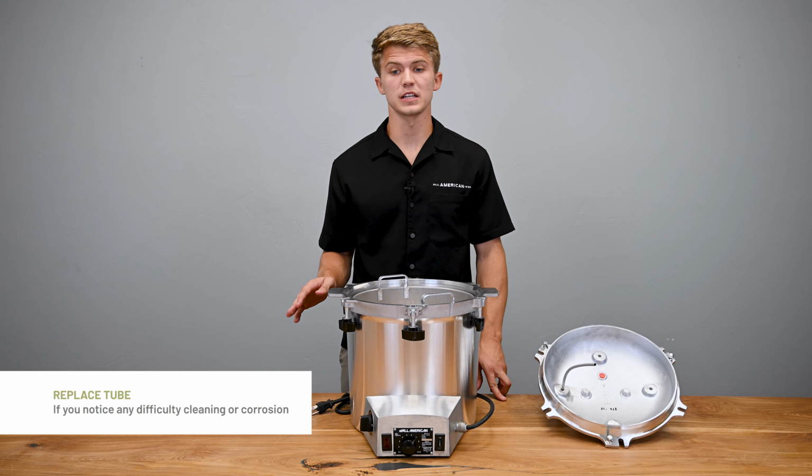All of our units come with wing nuts, pins, and bayonet clamps. Inspect all these components for any wear and tear or cracking. Although not common, we still recommend inspecting these components and replacing when necessary.